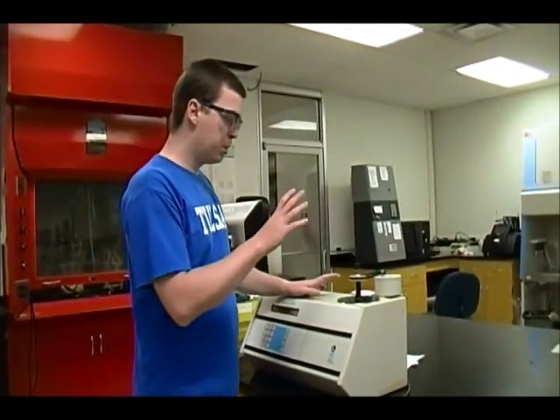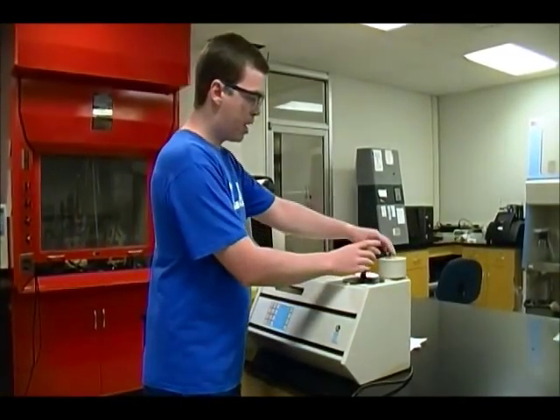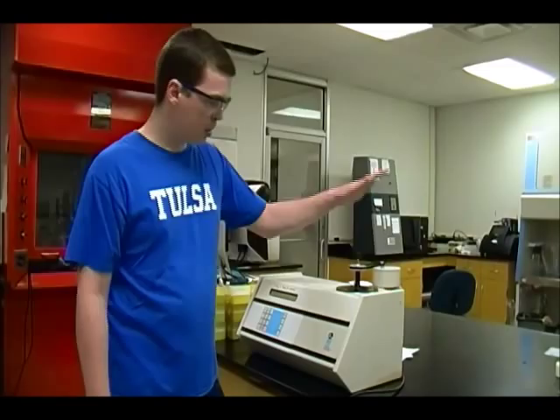Once you have your solutions ready, assemble the system just like you have before. Punch in the codes — they'll be slightly different than the calibration, so look to your procedure. Make sure you have your O-ring all hooked up, because once you punch in the codes the motor will start turning. Then it's just like before: wait for the first beep, pop the top, wait for the second beep, and get your data. Once the calorimeter is finished running, check the Teflon dish and make sure there aren't any purple spots left on the bottom. If there are, that means your potassium permanganate did not completely dissolve before you started, which unfortunately means you have to redo that part of the experiment. Check with your lab instructor to make sure everything dissolved properly.